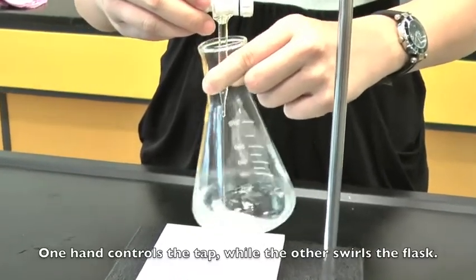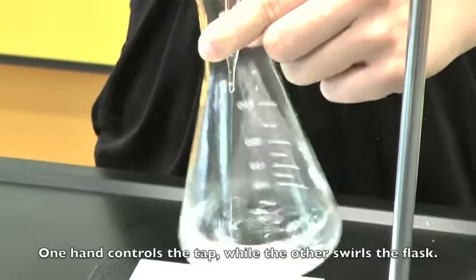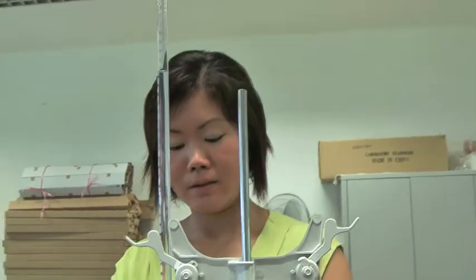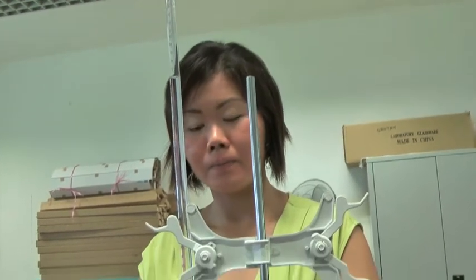The chemical should be delivered quickly until nearing the end point. If you know the end point, check the scales as you are carrying out the titration.